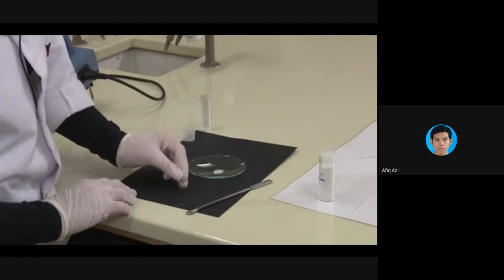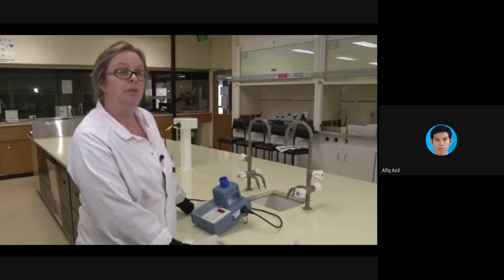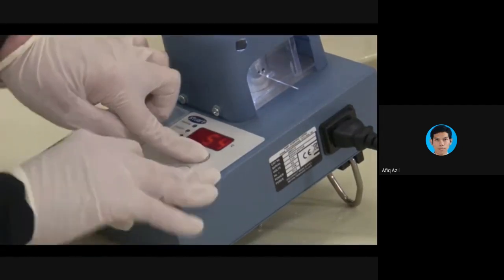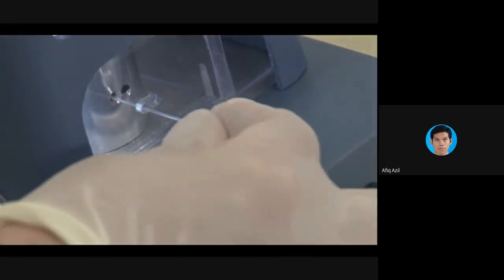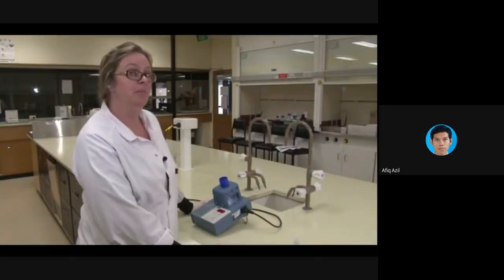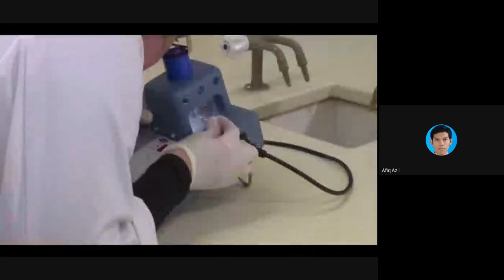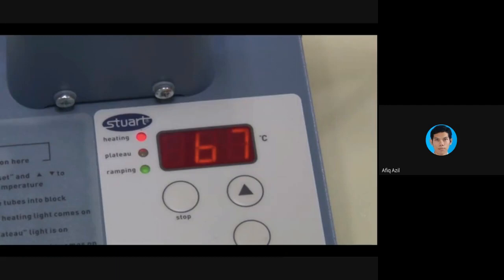So the melting point can be used to tell you what something is, but also how pure it is. The melting point range of a pure substance is between 1 and 3 degrees Celsius. You want to take the temperature just when it starts melting and when it's completely melted, and that's the range. For things that are impure, the melting point range will be up to 10 degrees. You'll probably find with this test, because you've got no idea what the melting point's going to be, that you'll need to do it a couple of times because you'll miss it the first time. Make sure when you're reading the melting point range that the temperature's only going up very slowly, about 2 to 3 degrees per minute.